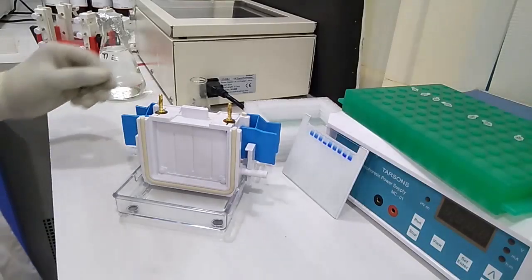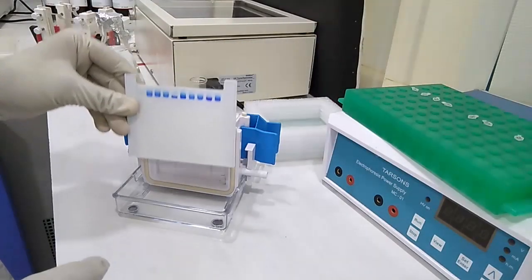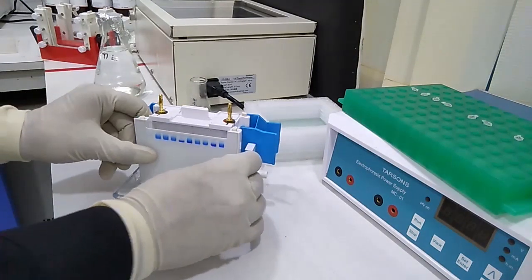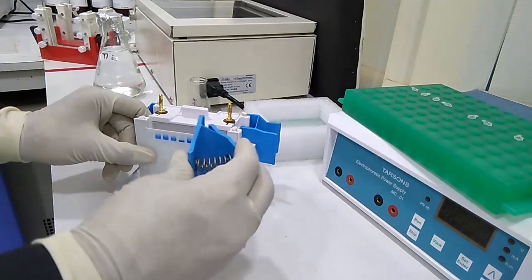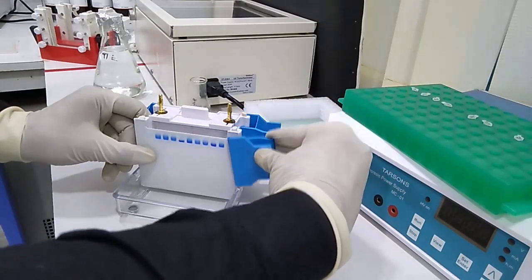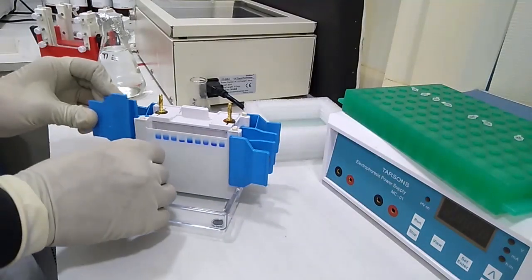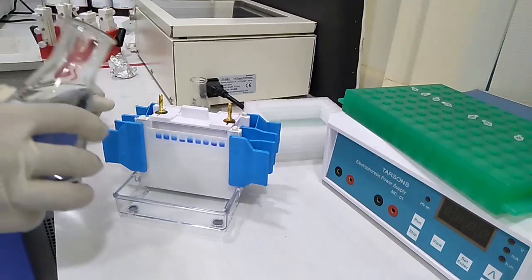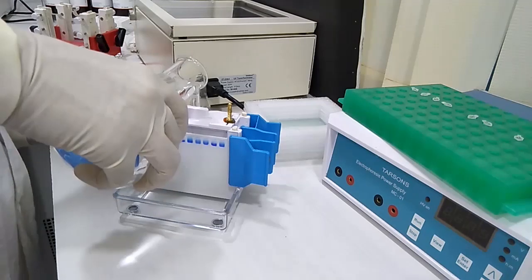I will load the gel to the electrophoresis machine like that. We will set this and clip like this. Now this is time to load the buffer here to the both side. This is the running buffer.